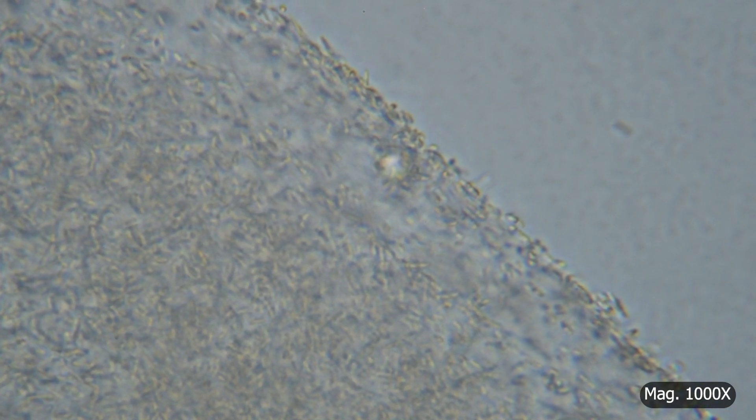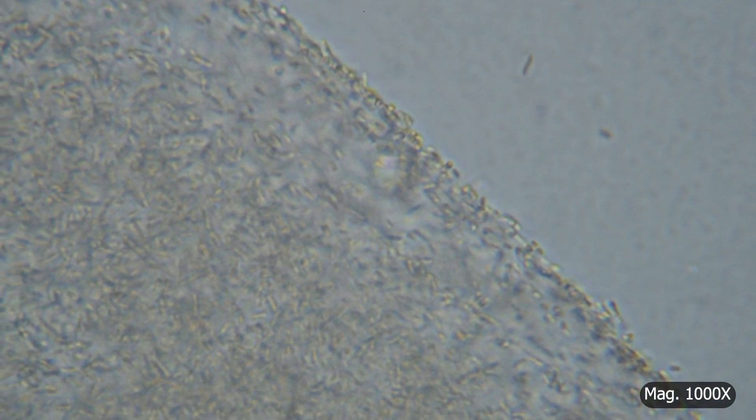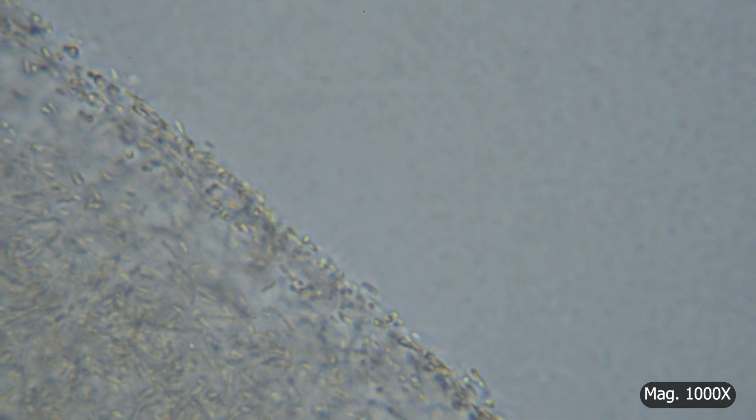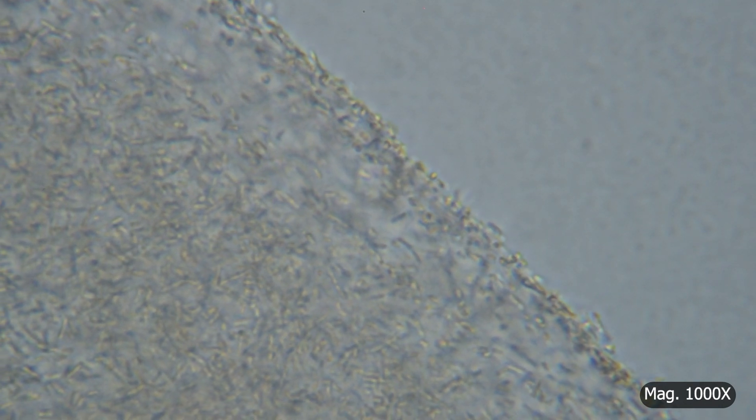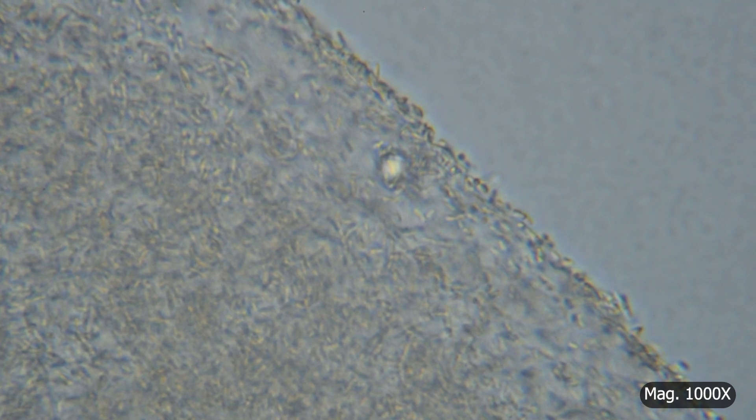The bacteria were bound to cellulose, and I discovered that if I adjust the focus and have the microscope lens gently press down on the mother, it will move the biofilm around.